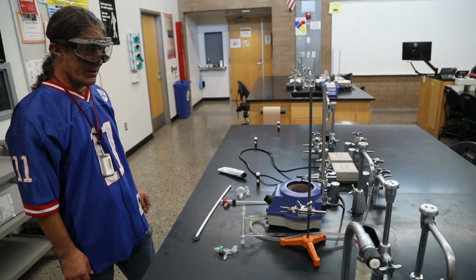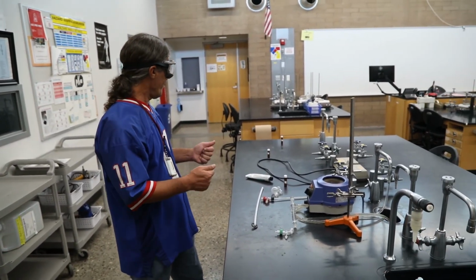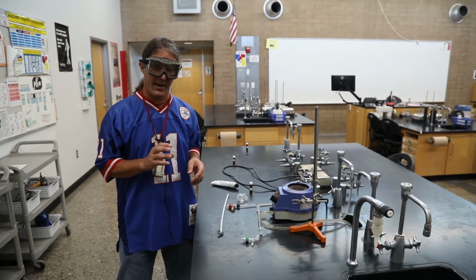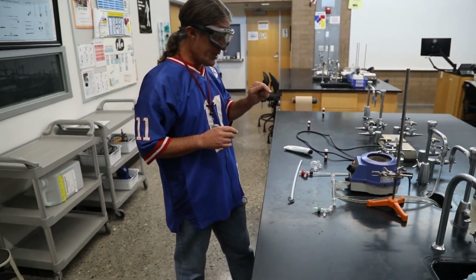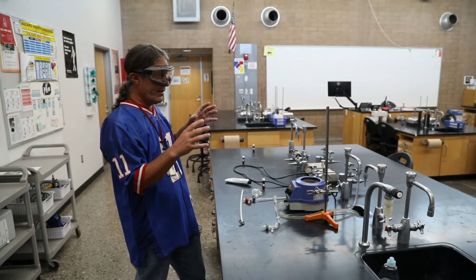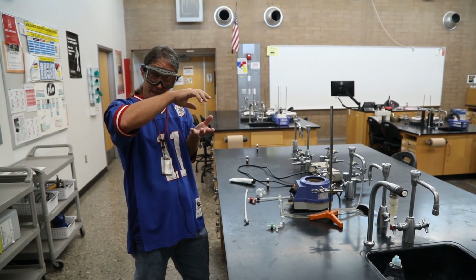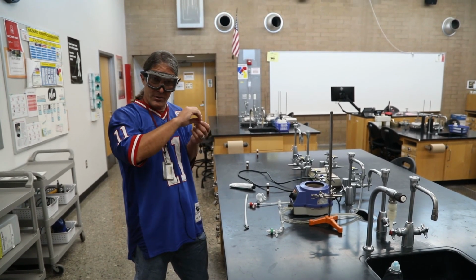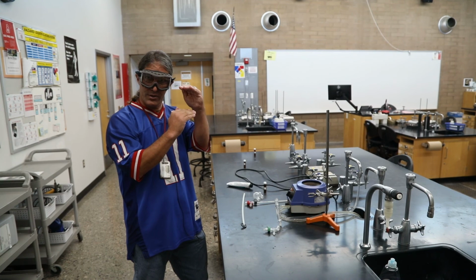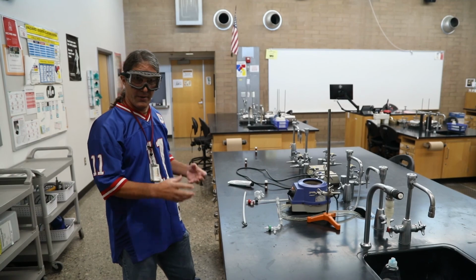The last thing I would want to do is look up the actual boiling point of hexane, and the sheet's not in front of me, but I think it was 68.5 degrees. We'll have to check that when we review this. But this was distilling at 66. And again, what that's going to tell us is that today the atmospheric pressure is a little lower, so it's impeding the boiling a little bit, so it's going to boil at a lower temperature. So now if I'm trying to identify an unknown, we have to realize that a real boiling temperature is going to be a little lower than the literature temperature because our pressure is a little lower than atmospheric pressure.